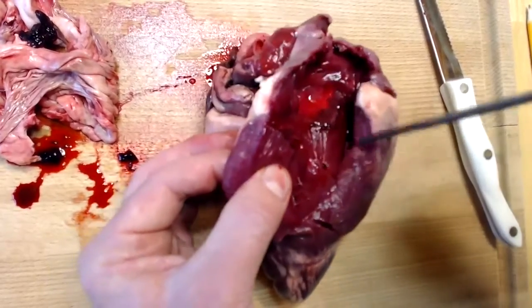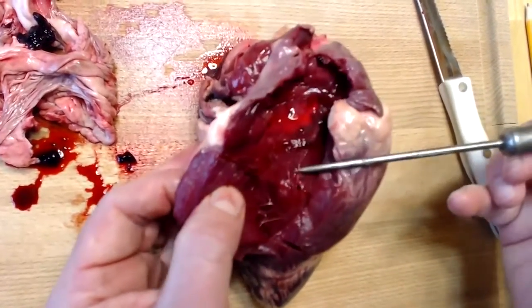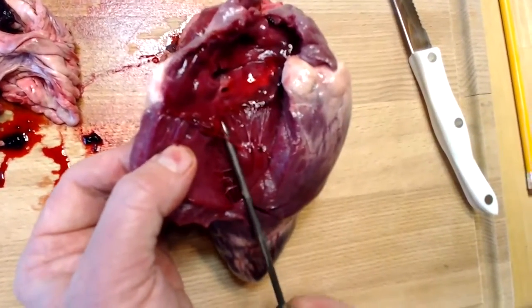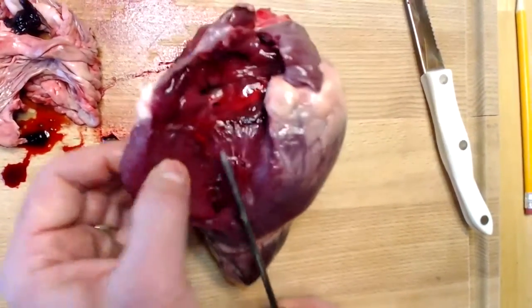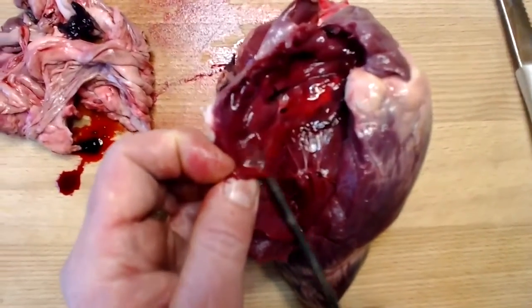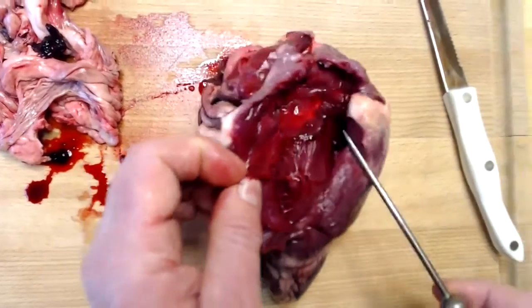And there'll be other papillary muscles as well, but this is one of the larger ones. And so as we trace these chordae tendineae upward, superiorly, we can encounter the tricuspid valve. And so we can see just underneath the probe, this very thin material right here, very, very thin. This is one of the cusps, one of the three cusps of the tricuspid valve.